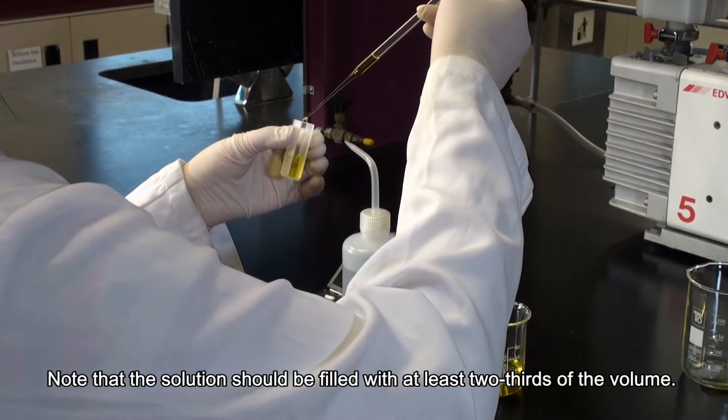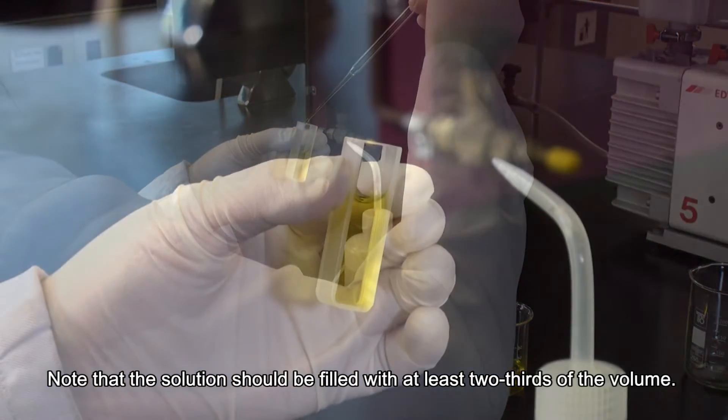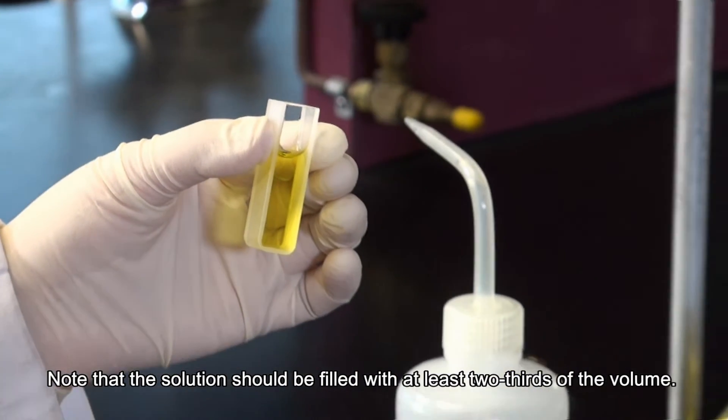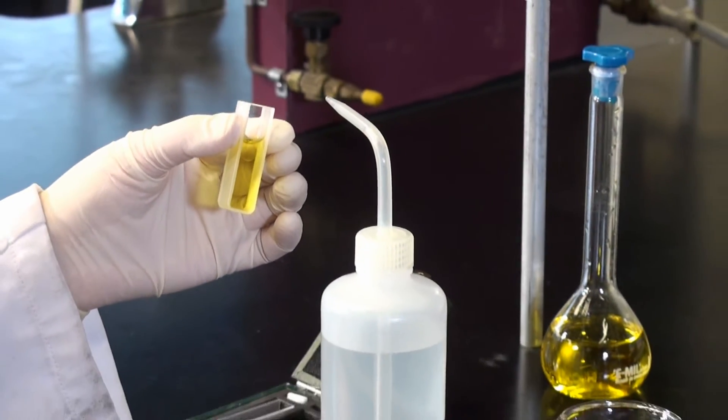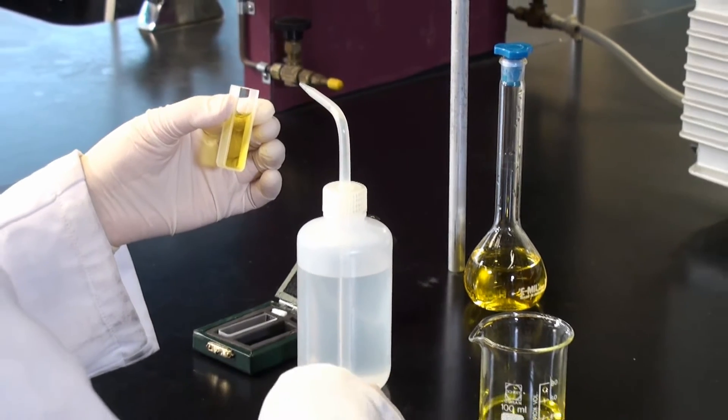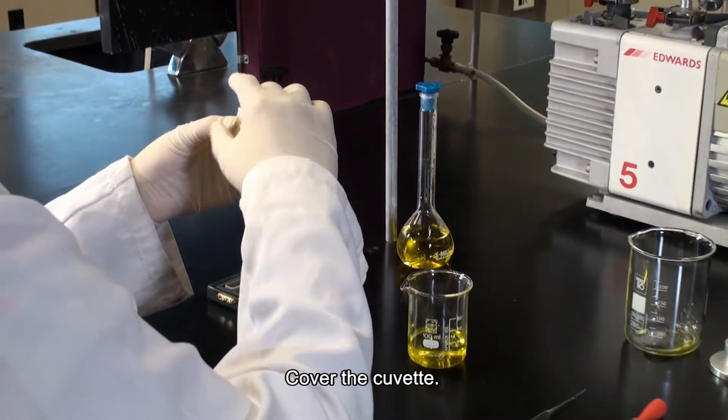Note that the solution should be filled with at least two-thirds of the volume. Cover the cuvette.